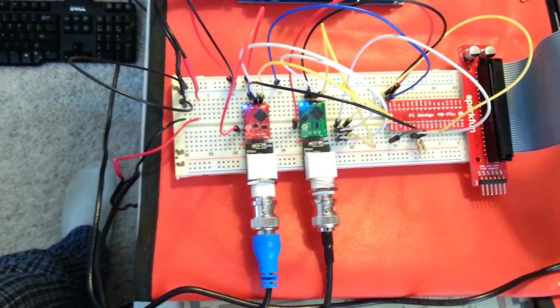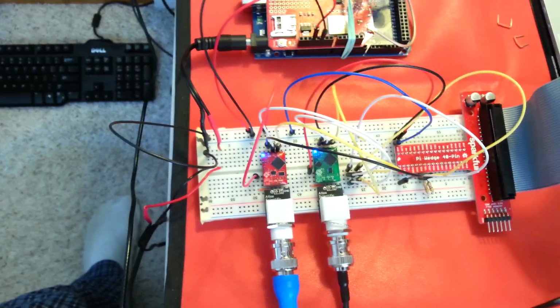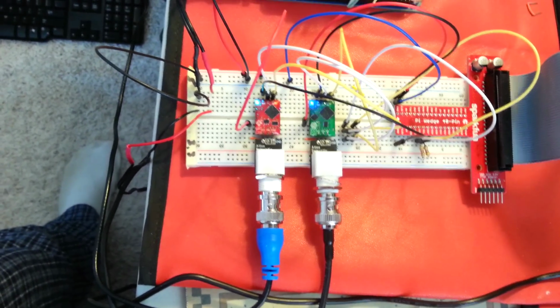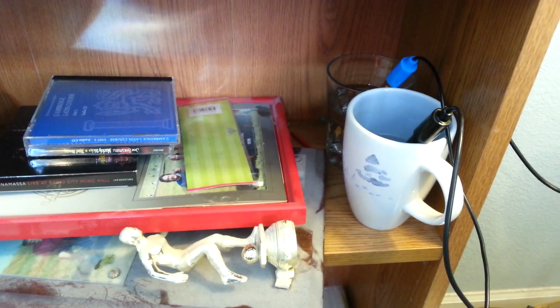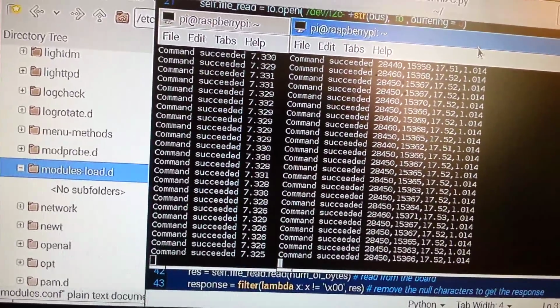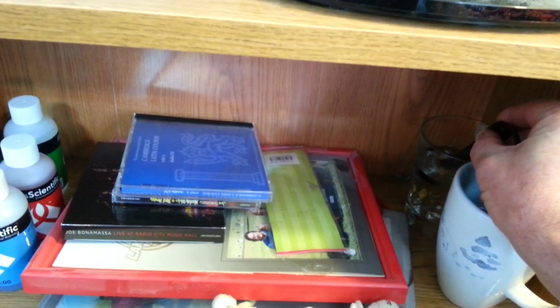Because I couldn't tie the grounds together, I could not see both of the I2C probes when I pulled up the I2C grid on the Pi, which I'll show you in a sec. So both probes, one's put in salt water, one's put in fresh water. My fresh water is from a reverse osmosis, and the EC probe just wouldn't read anything. So you can see now, you can see the values rotating along, changing periodically. Let's just see what happens if I put the EC probe in with the pH.